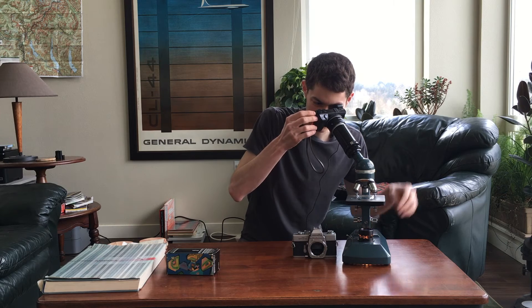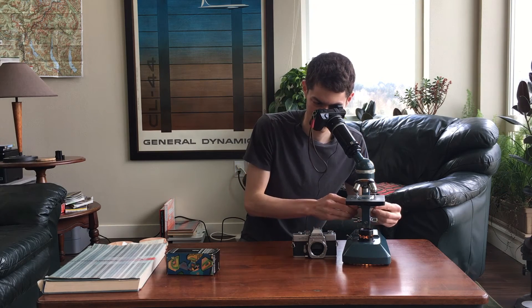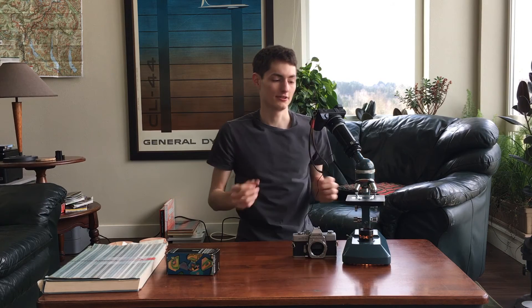This is on the lowest magnification for the actual objective optic, going through the eyepiece which has about 15x magnification set currently. It's a little hard to control right now, but kind of interesting looking — a little dark because I'm shooting video. Pretty interesting. I'll just go up one more zoom level. So that's one way to set up the whole microscope adapter.